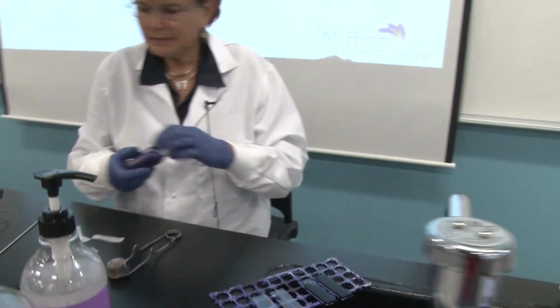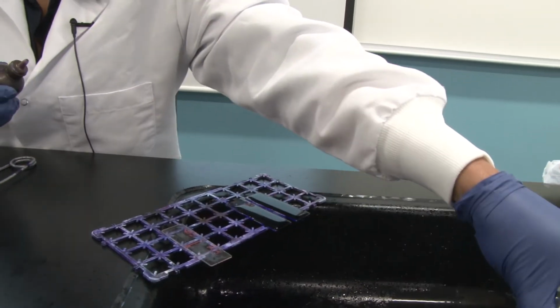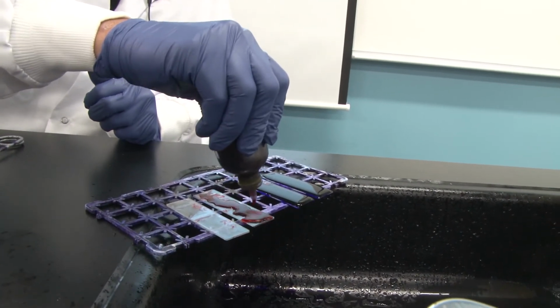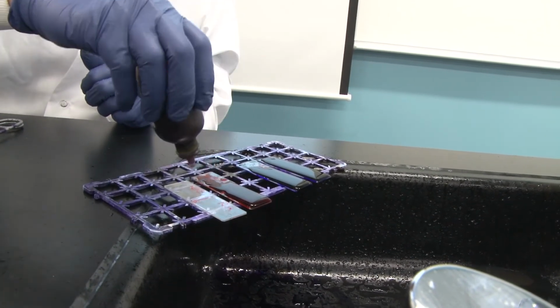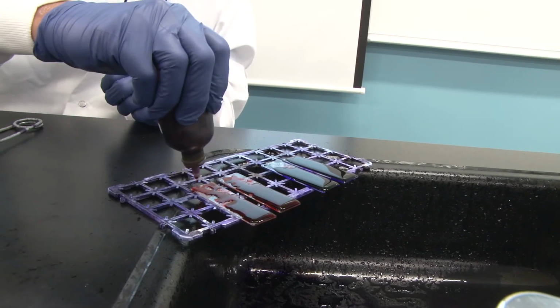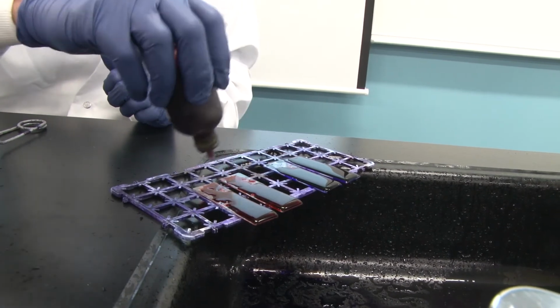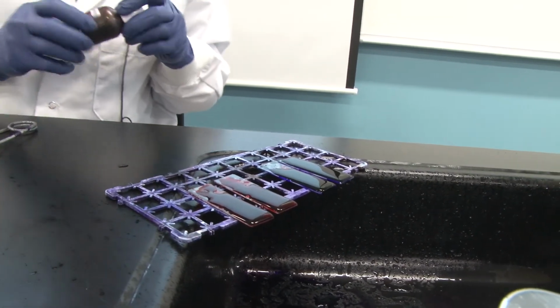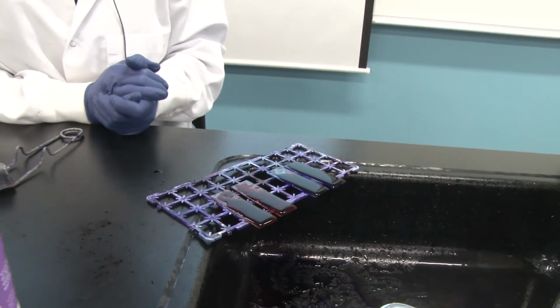Okay? On this second set of slides, see, I got a little drop of crystal violet on that, so I'm going to wash that off. On the second set of slides, I'm going to add safranin, our second basic dye that we are going to work with. And you notice the color here is pink. Obviously, crystal violet tells you it's going to be purple. Safranin is pink. These are two dyes we are going to work with later in the semester to do differential staining rather than simple staining. And the first stain we're going to do is called a gram stain, and we'll use both of these dyes at that time.